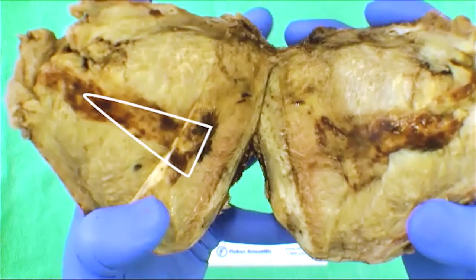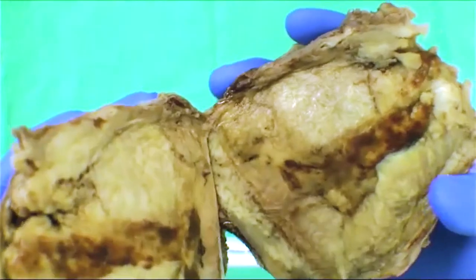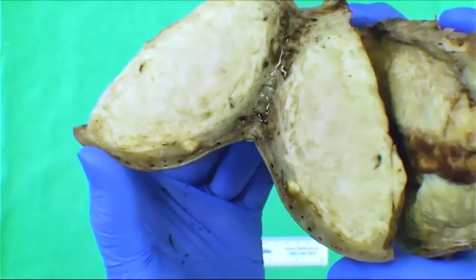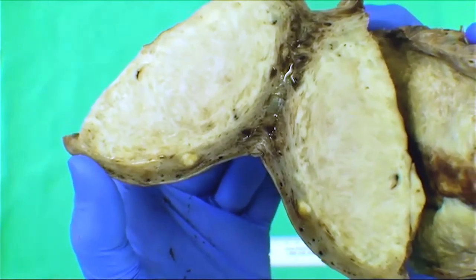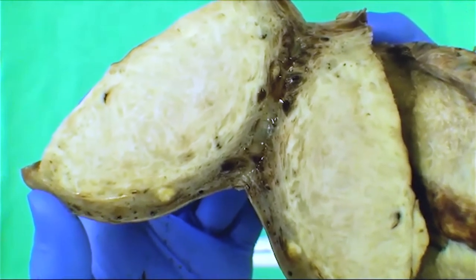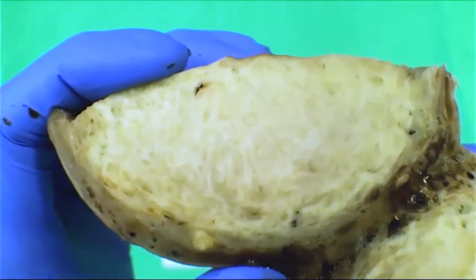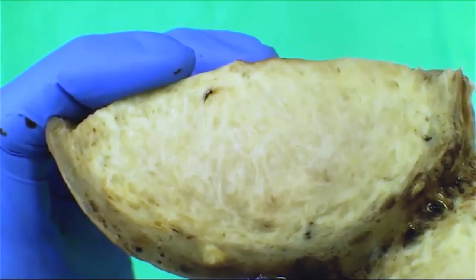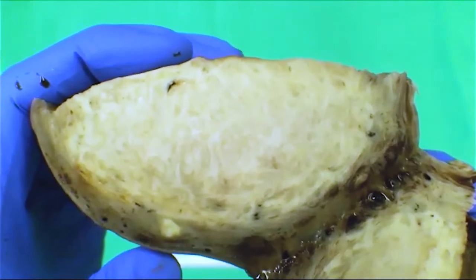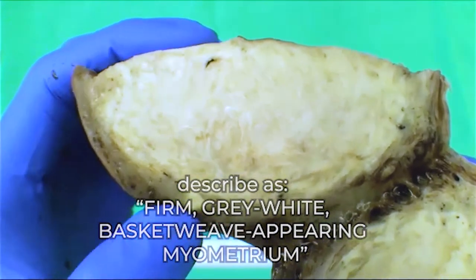You can see the endometrial cavity — this congested-appearing tissue — and then a really thick myometrium around it. On the cut surface, can anyone in the chat tell me the classic gross description for what we see here? Very nice — basket weave. You can see how it wisps and whirls around in a pattern. Underneath where my thumb is, that's the regular myometrium, more rubbery in consistency and color.